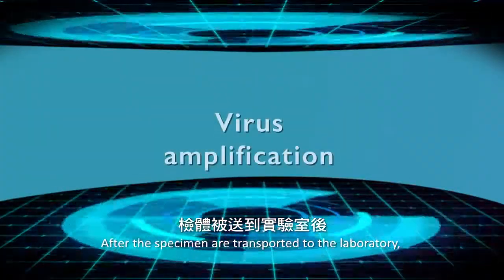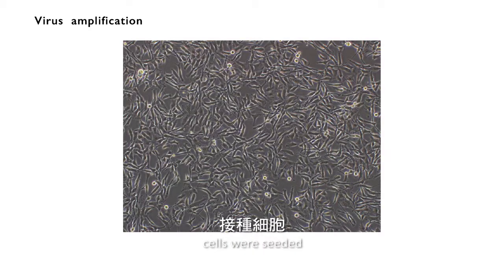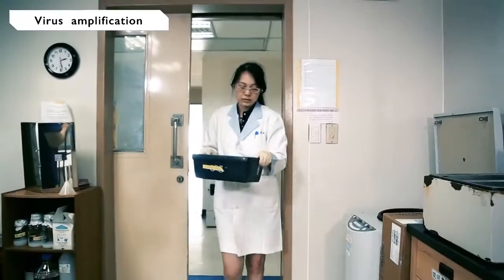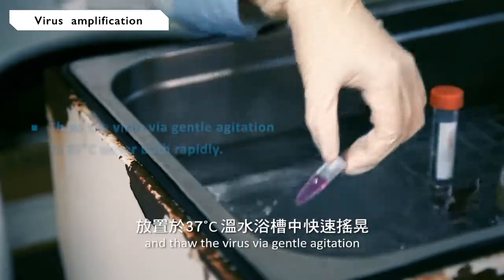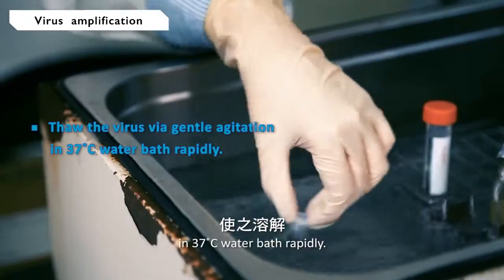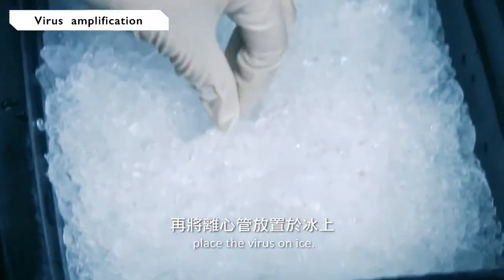After the specimens are transported to the laboratory, we will amplify the virus in the specimen for further identification. First step, cells are seeded to monolayer confluency before virus infection. Virus is taken out from the minus 80 degrees Celsius refrigerator and thawed via gentle agitation in a 37 degrees Celsius water bath rapidly. After the ice crystals melt, place the virus on ice.